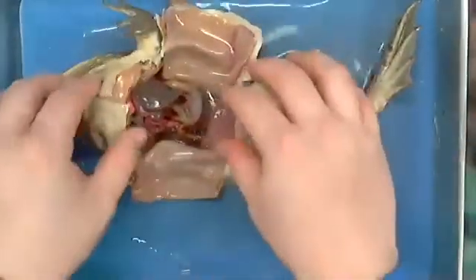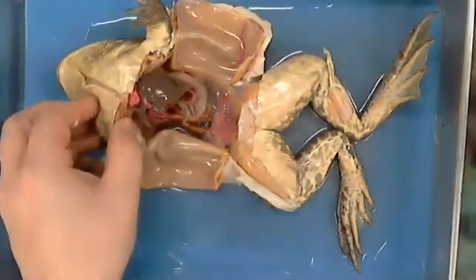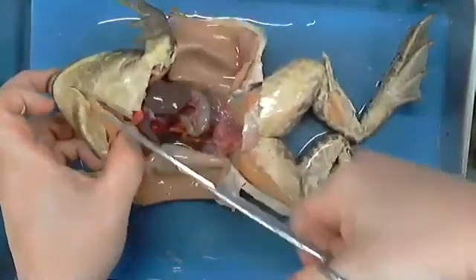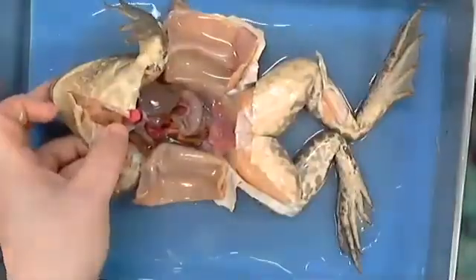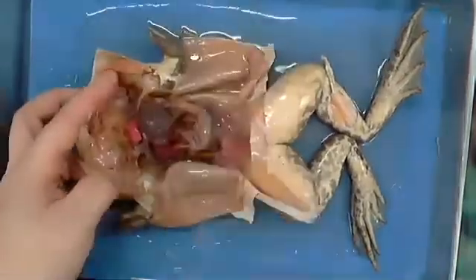All right. So that's that. Now let's take a look. I'm going to cut through basically his sternum, which would be this dead center section that you see right here. You'll kind of hear me break bone here as I do so. All right, and then basically all I'm going to do is pull them apart. So I'm going to open them up like this so that we're not fighting it, so that you can see.